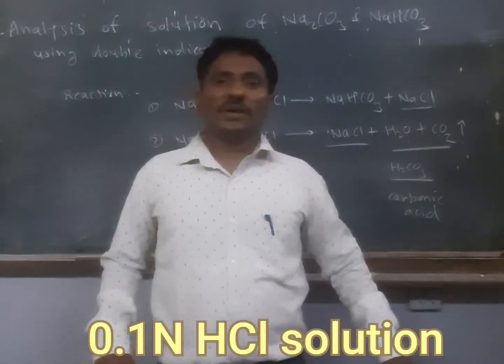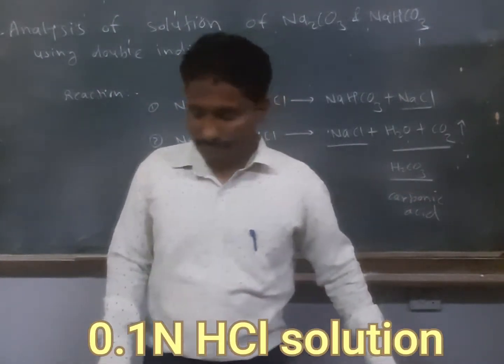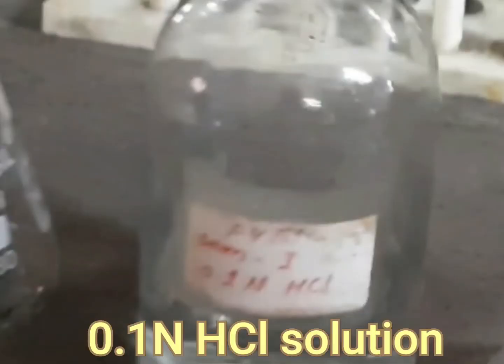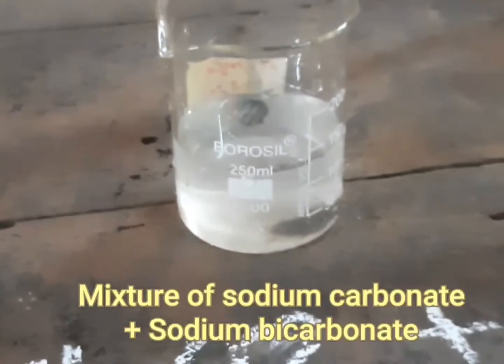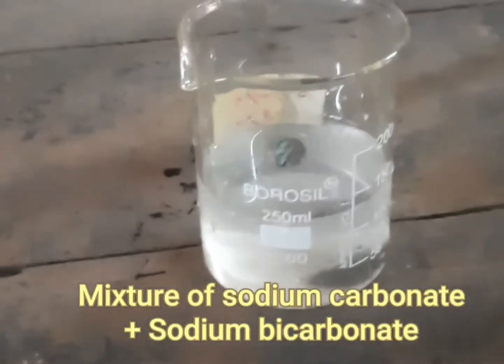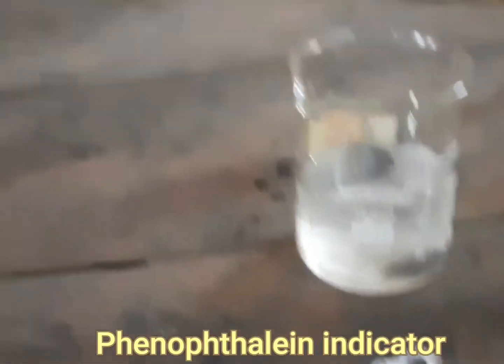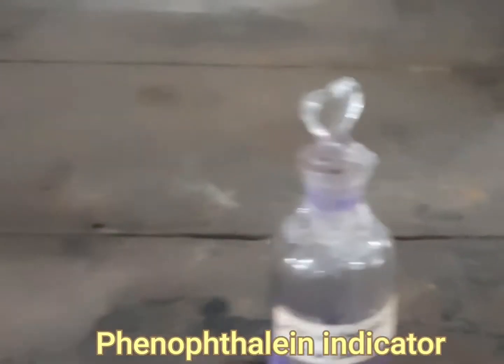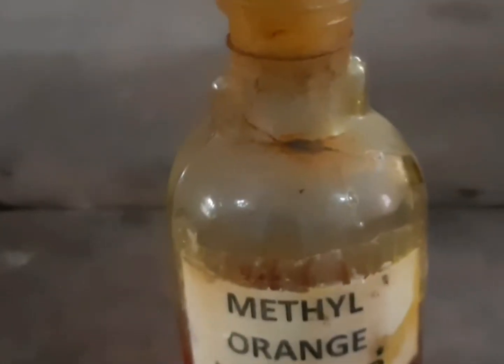The chemicals required for the practical are: 0.1 normal HCl solution, a mixture of sodium carbonate and sodium bicarbonate, phenolphthalein indicator, and methyl orange indicator.